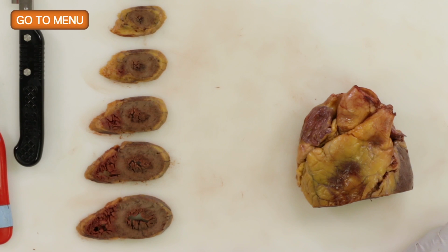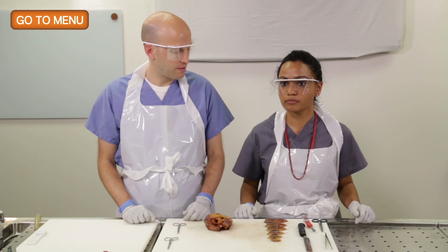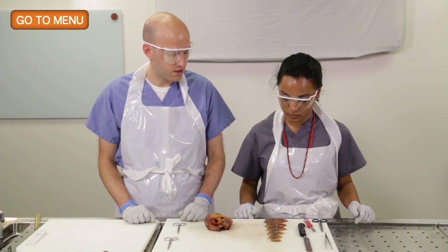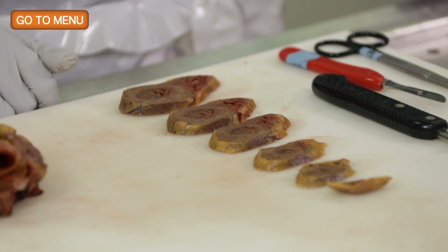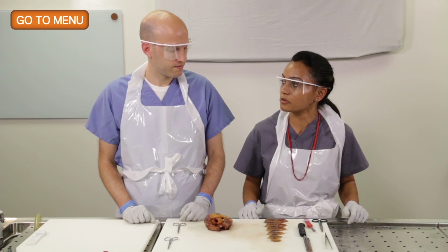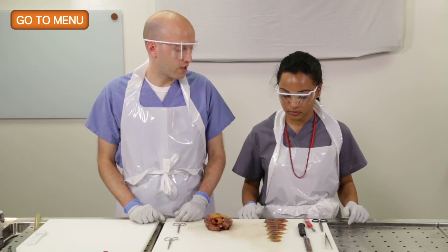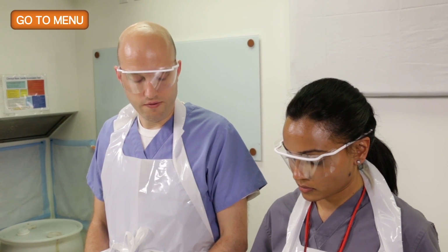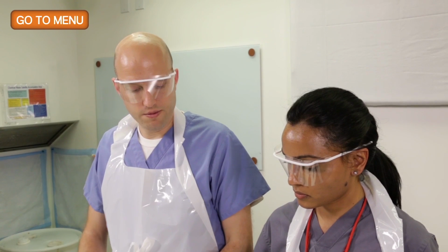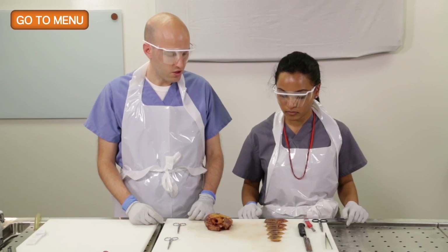Can you think of any conditions in which the right ventricle would be thickened? Maybe to even the same size as the left ventricle in some cases? If you have hypertrophy of the right ventricle, called cor pulmonale. Yeah, so generally in lung diseases, the right ventricle can thicken significantly with pulmonary hypertension, and you're right, cor pulmonale is a term for that in some cases. And so we do see that from time to time. This patient, I would say, does not have that, because you can see how thin and normal appearing the right ventricle looks. Okay, so that is the apex.